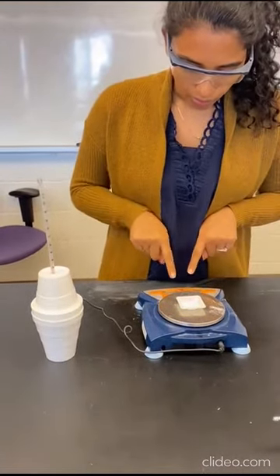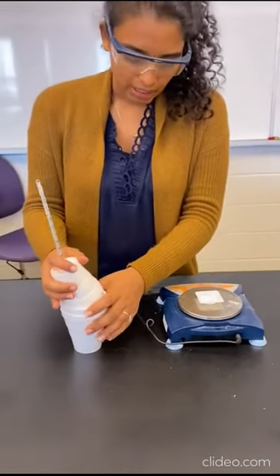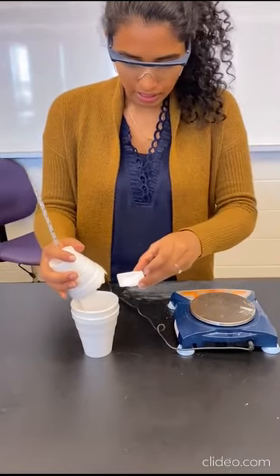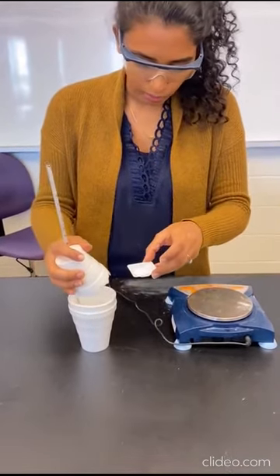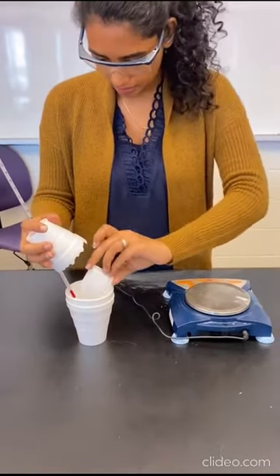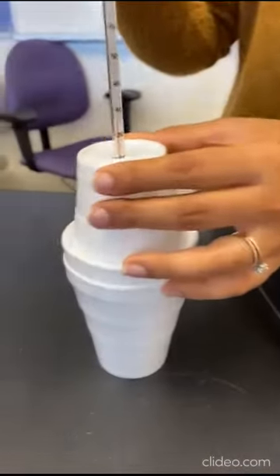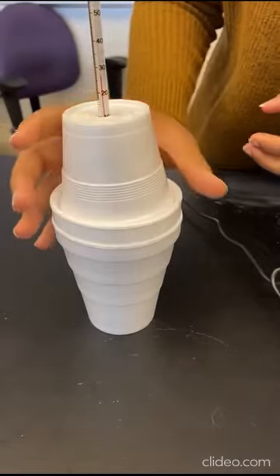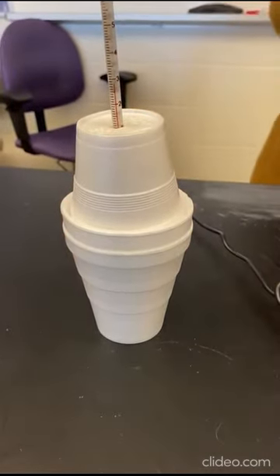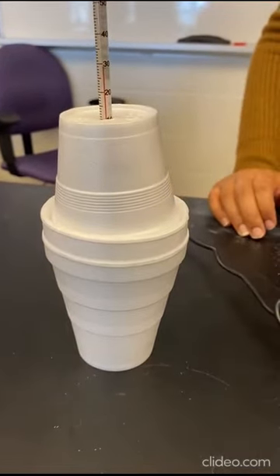So I've measured out 1.01 grams of magnesium oxide. I'm going to do exactly what we did in reaction 1. Add this into my calorimeter. I'm going to do this very quickly and close the calorimeter so that I can catch the temperature change immediately. So I don't hear anything, but I see the temperature is jumping very quickly.